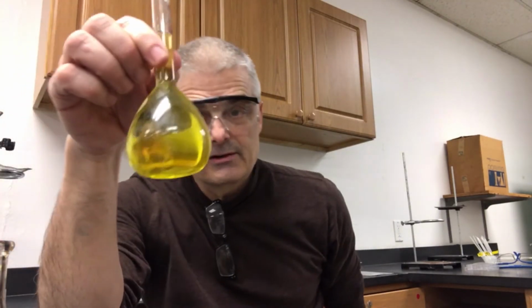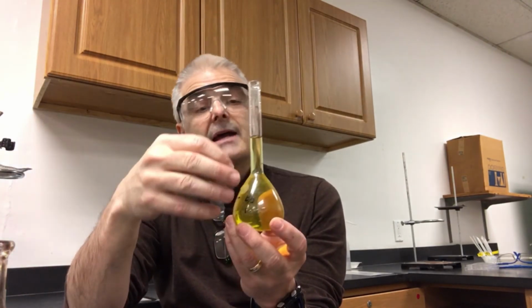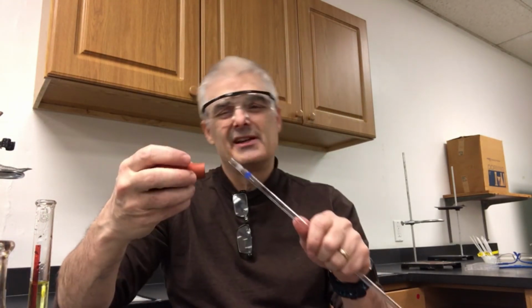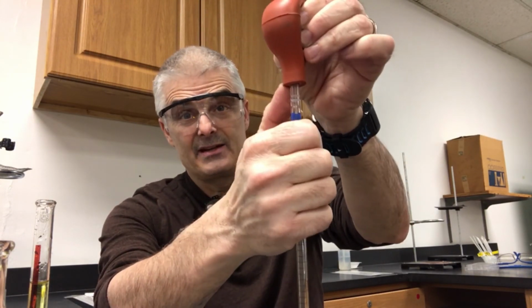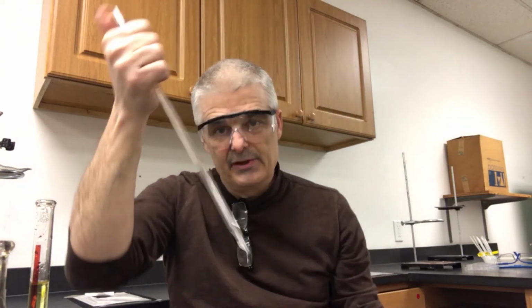I can figure out the exact molarity of this solution because I know that I had 15 milliliters of the 1 molar chromium, diluted to 100, and I can calculate the exact molarity of this particular compound. So that's how you do a dilution. Now in class, you're going to have to practice. Again, reminder: you squeeze, and when you draw it up, you want to go past the line, flick your hand off, put your thumb over the top, and you don't take your thumb off, you just relieve pressure, and then the liquid starts to drip down. It's a skill, you'll practice it in class, and it will work.